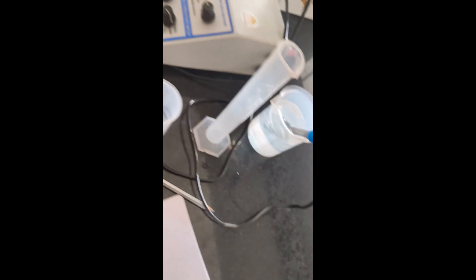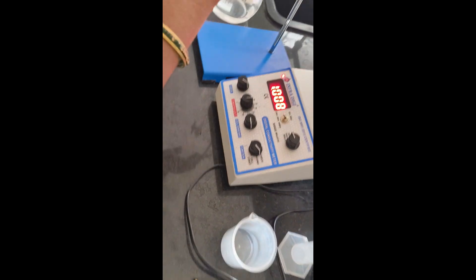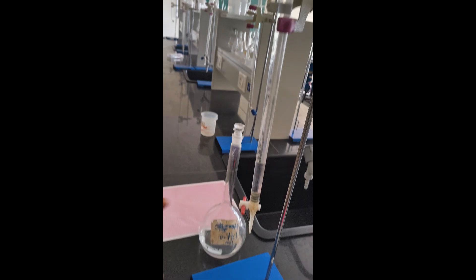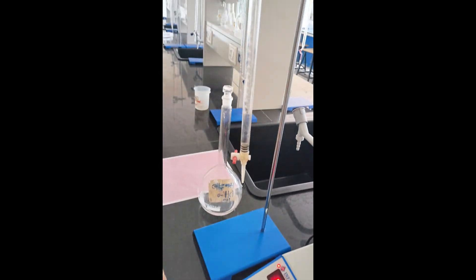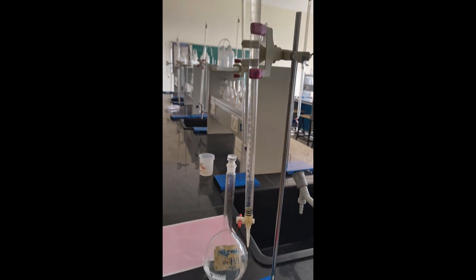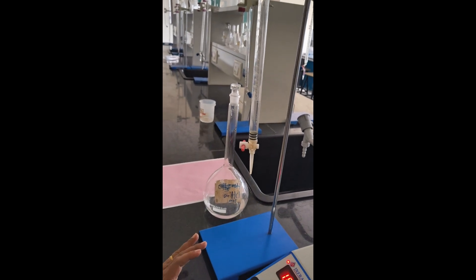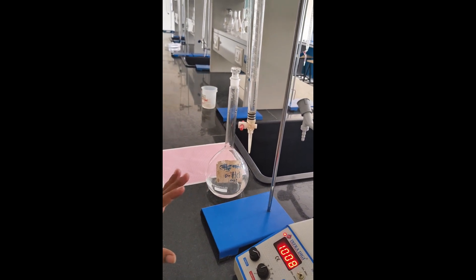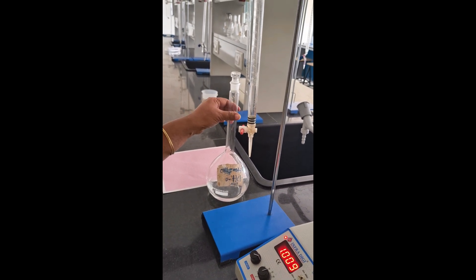Coming to the solutions: NaOH and HCl solution. NaOH is the strong base; HCl is the strong acid. NaOH means sodium hydroxide; HCl means hydrochloric acid.